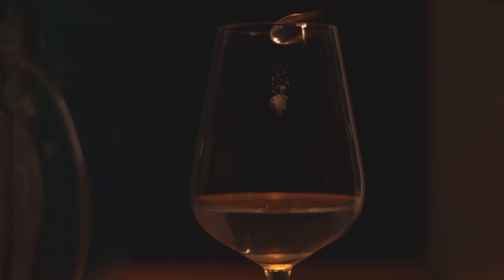So as you can see, not a lot really happens when it's falling down towards hitting the water. Let's just stick with this for the moment — we hit the water and not a lot happens. That's really not very impressive.